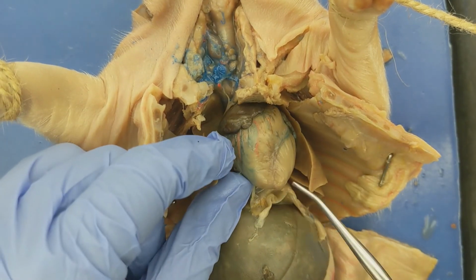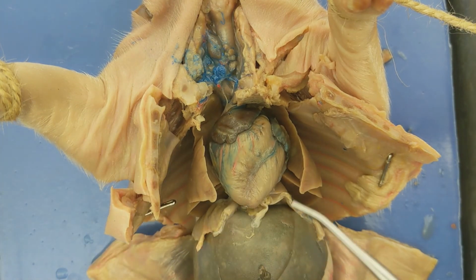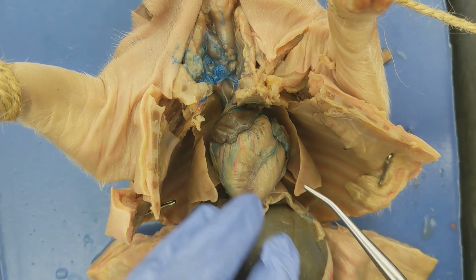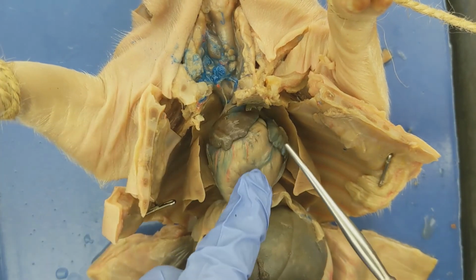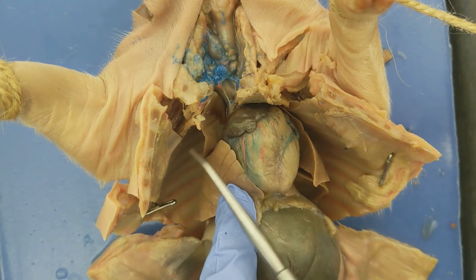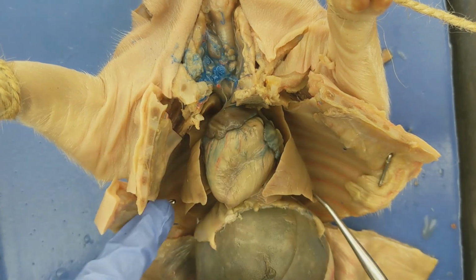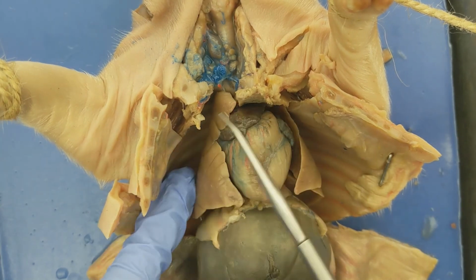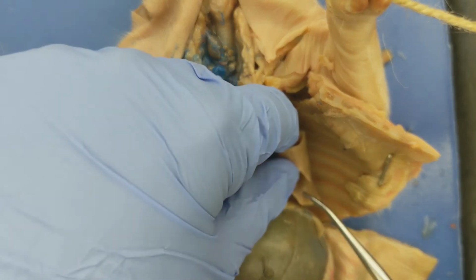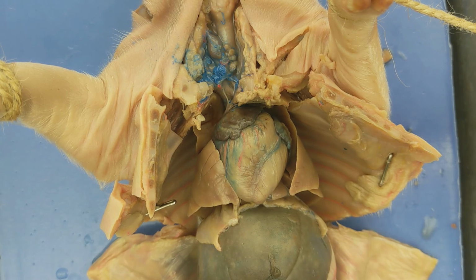So of all the 4 chambers, the left ventricle here is actually the most muscular because it pumps blood throughout the body. So there's a lot more places that it needs to reach, right? The other thing you see in the thorax, besides the heart, are the lungs. So you have the lungs here on the right, and you have lungs over here on the left. You'll notice the lungs are made up of lobes, right? They're not just one entire structure. They're made up of smaller lobes, which are divided. All right, so heart and lungs and our thorax.